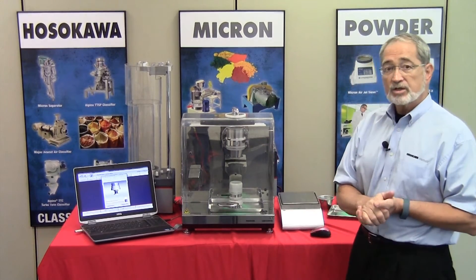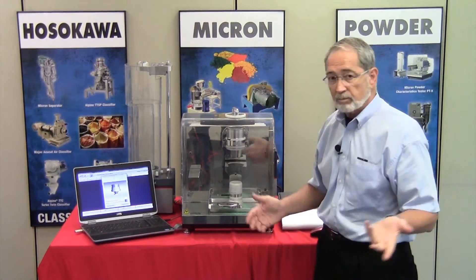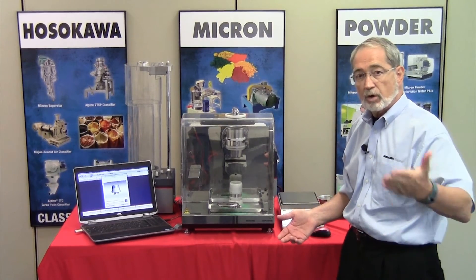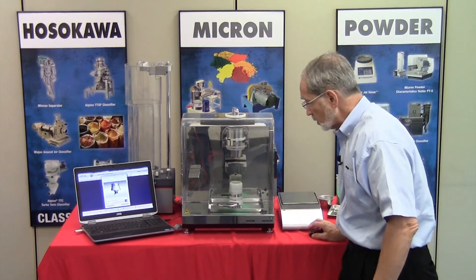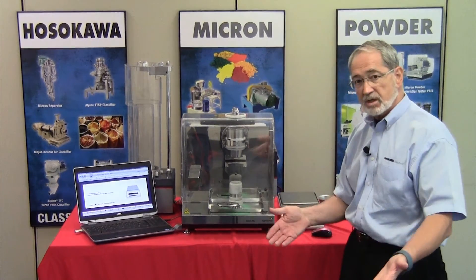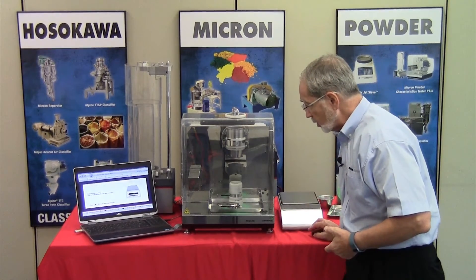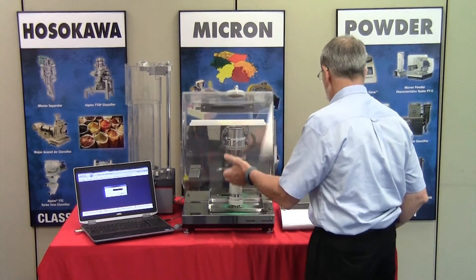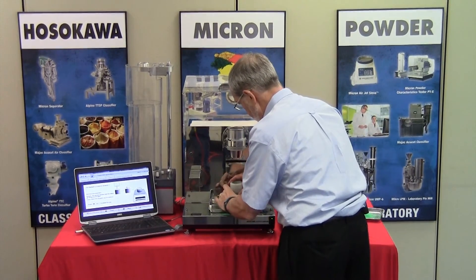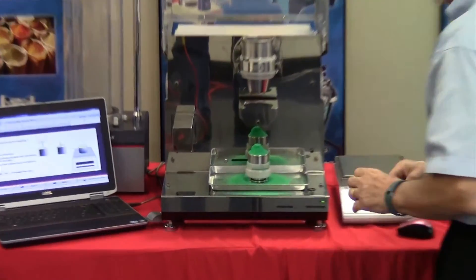For demonstration purposes, we will stop at approximately 120 taps and proceed as if going through the full 180. Pressing stop advances the software, permitting the balance to be tared. While the balance is being tared, we remove the cup extension.